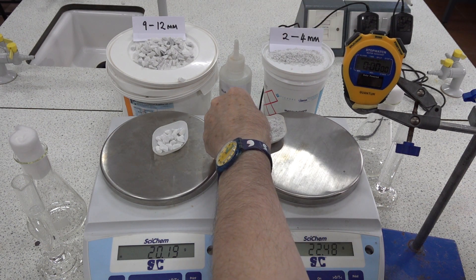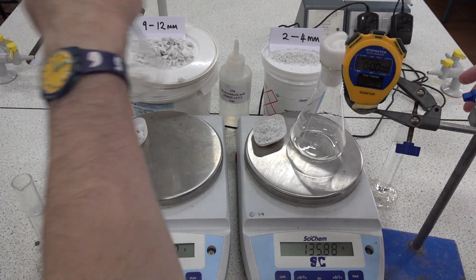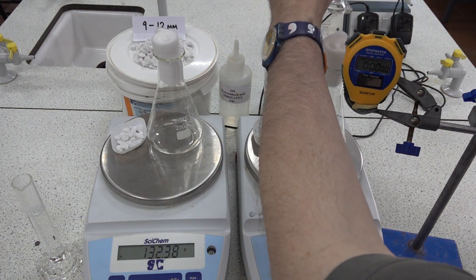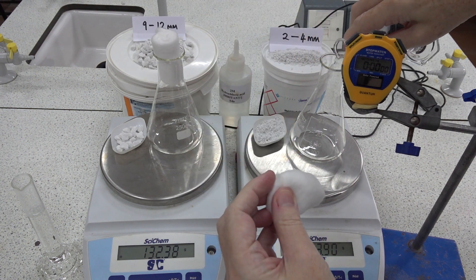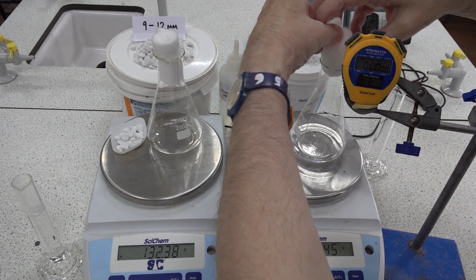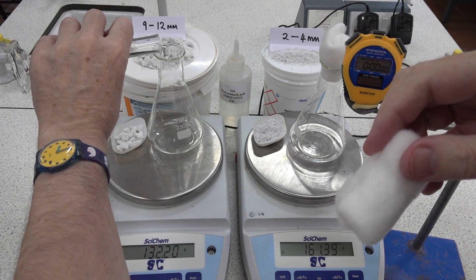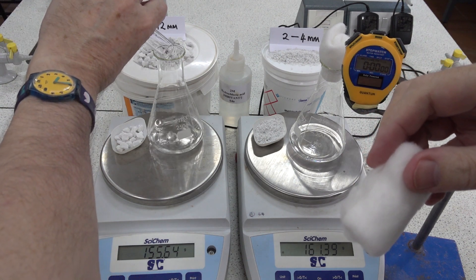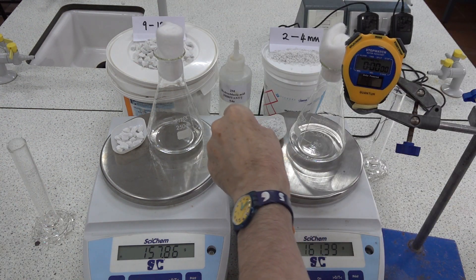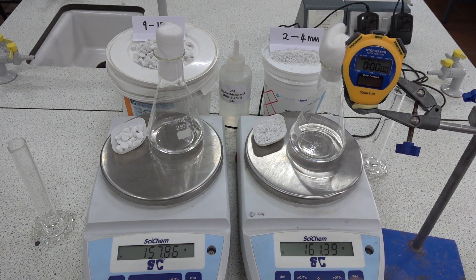So let's start by putting the apparatus on the balance. We've got two identical flasks, each with a cotton wool plug, and we've got 25 centimetres cubed of hydrochloric acid into each flask. You now need to note down the total mass of the two systems — the large and small chips — at time zero.